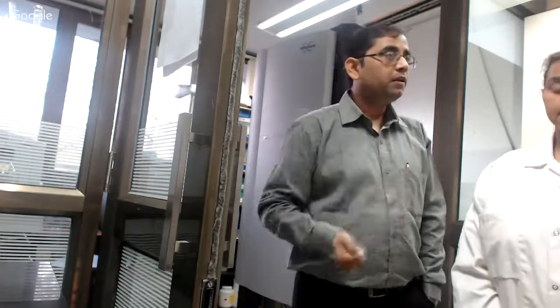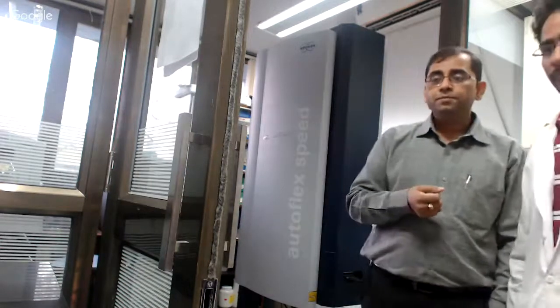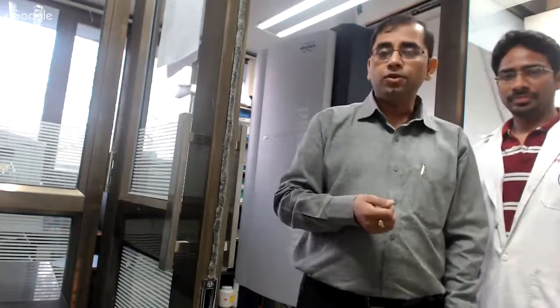I also have with me a teaching assistant. Please come here. He's Mr. Vipin. He's a senior PhD student. He is pretty much involved in this course as the official TA for the course. He is going to show you the hands-on part of how to prepare the samples.